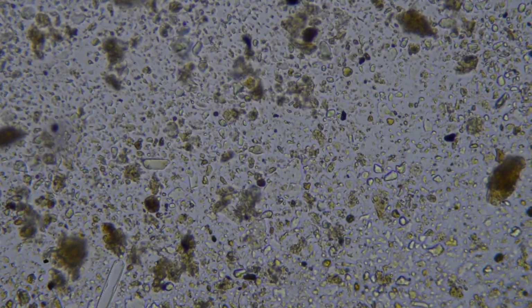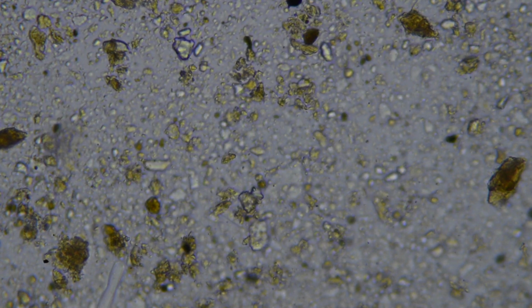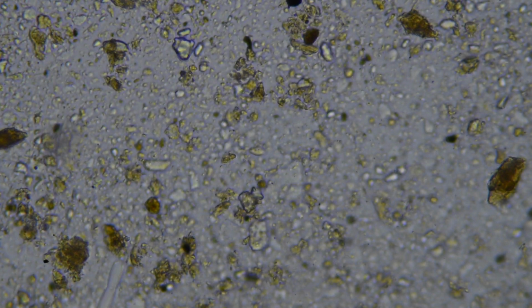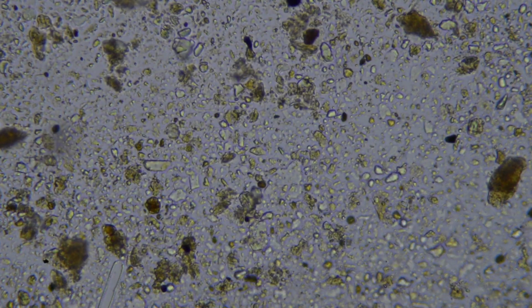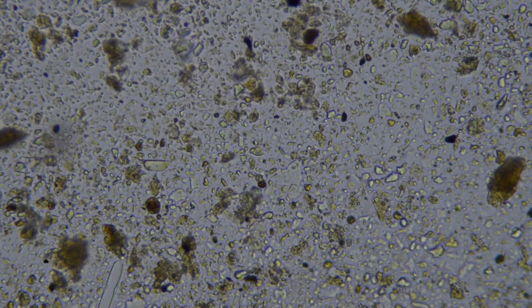We want to see bacillus, the more classic rod-shaped bacteria that most people are familiar with, and I'm not seeing many of those. It's quite good to see lactobacillus. They can sometimes be a slight indicator of anaerobic conditions. But like I say, we're really aiming for diversity here.